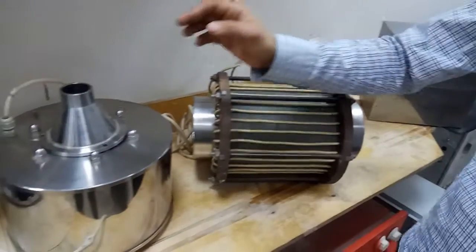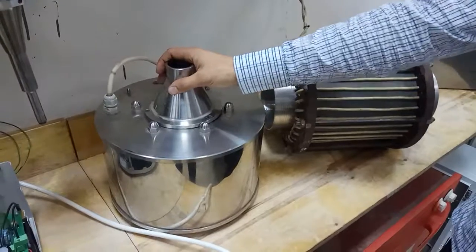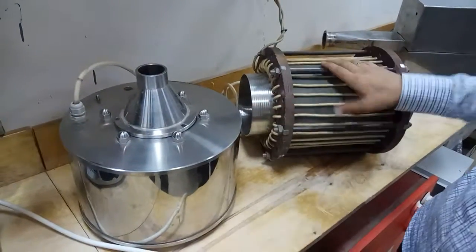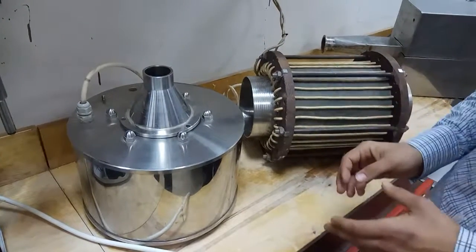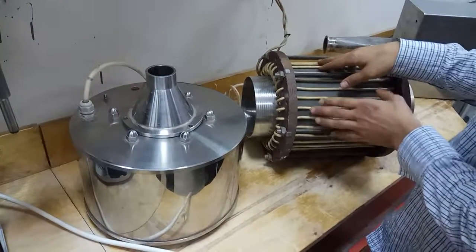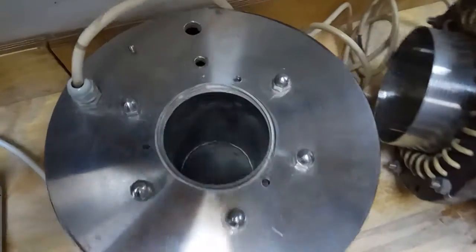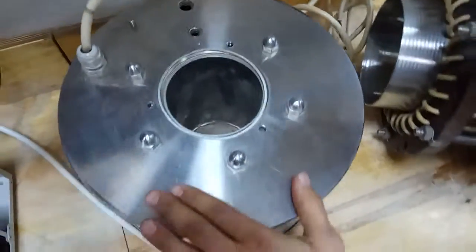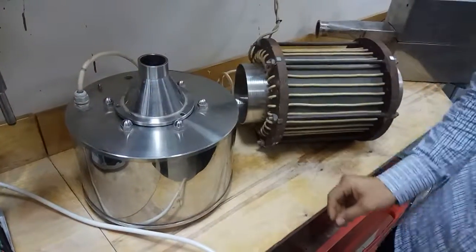This is a flow reactor based on a piezoceramic transducer. The principle of operation is the same. Between this one and this one it is the same. The only difference is that here is magnetostrictive material, and inside this box piezoceramic. Here is a piezoceramic that acts on this tube.